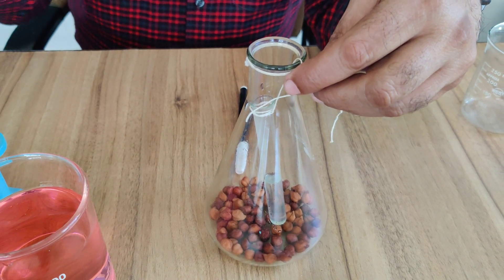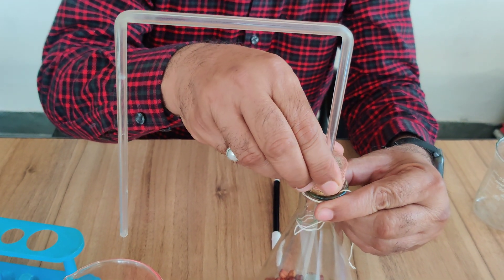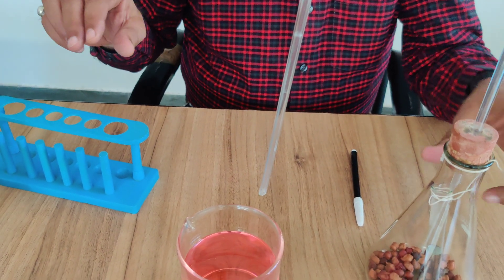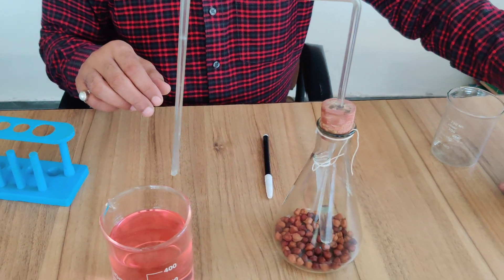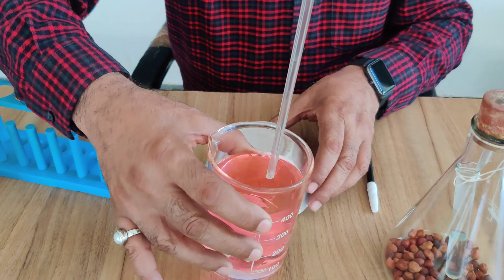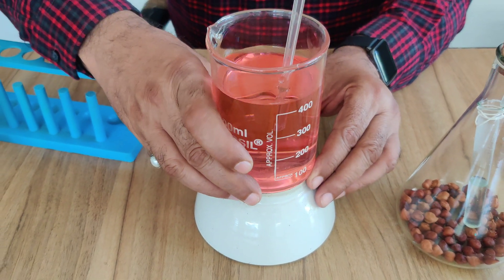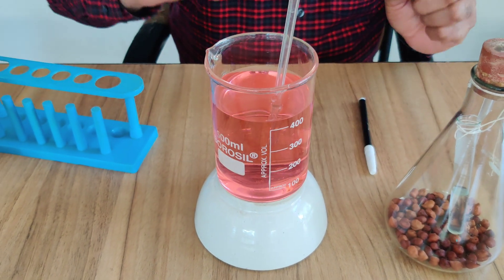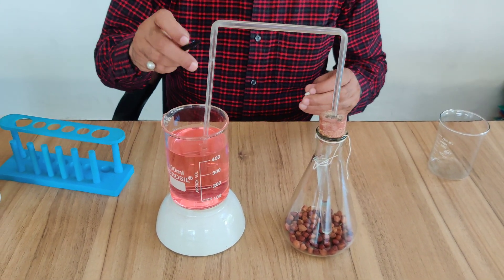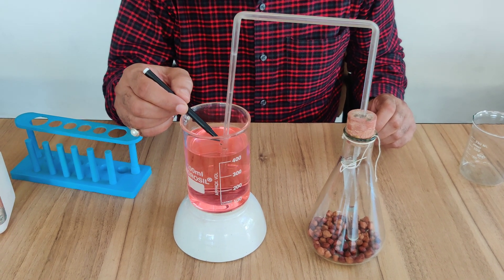And fit the delivery tube here, like this. Now, we have to put the delivery tube into this colored water and arrange it so that it remains in the red colored water. Where the level of water is, I am marking the level with the help of this marker.